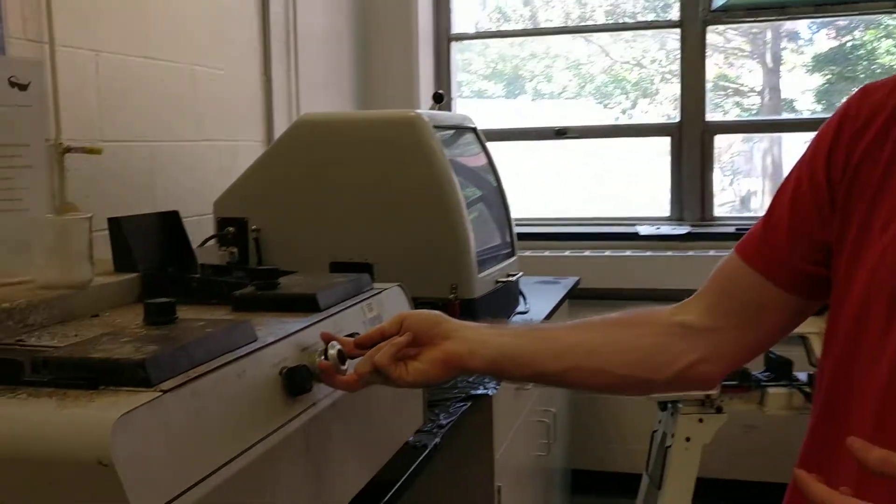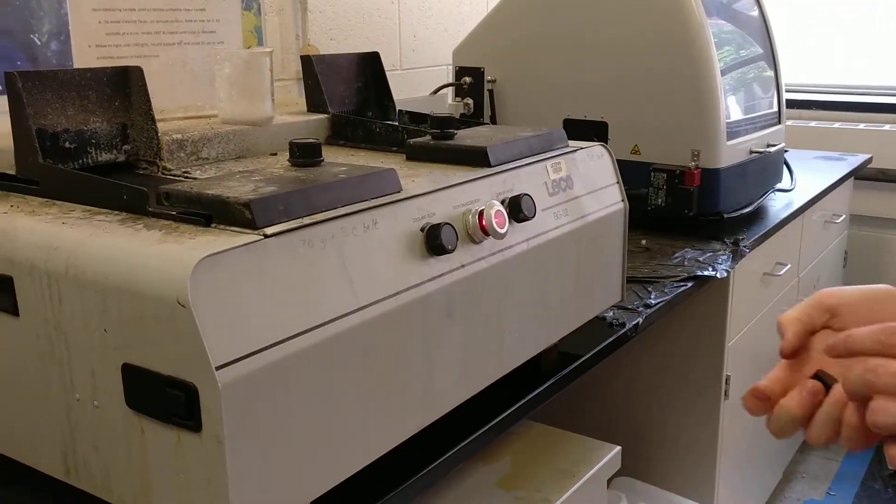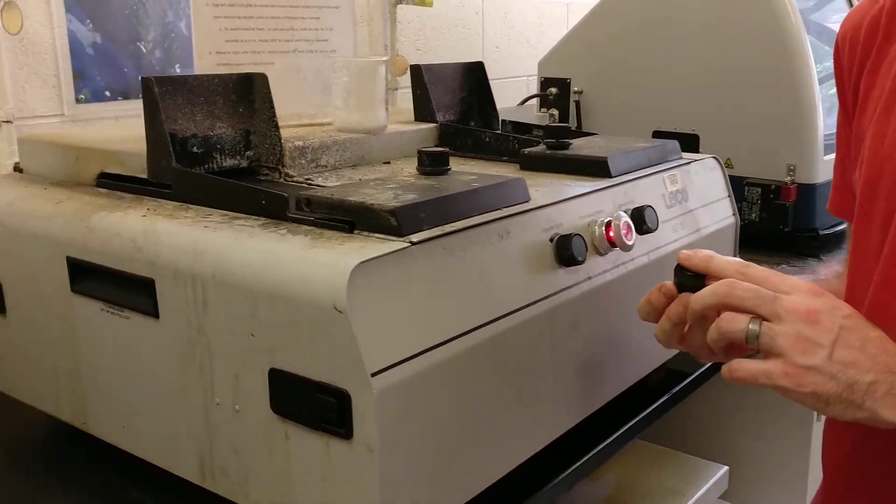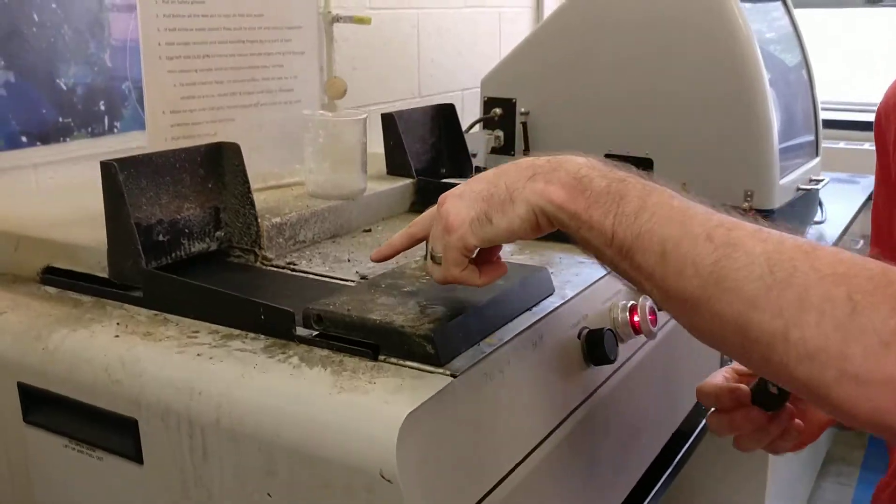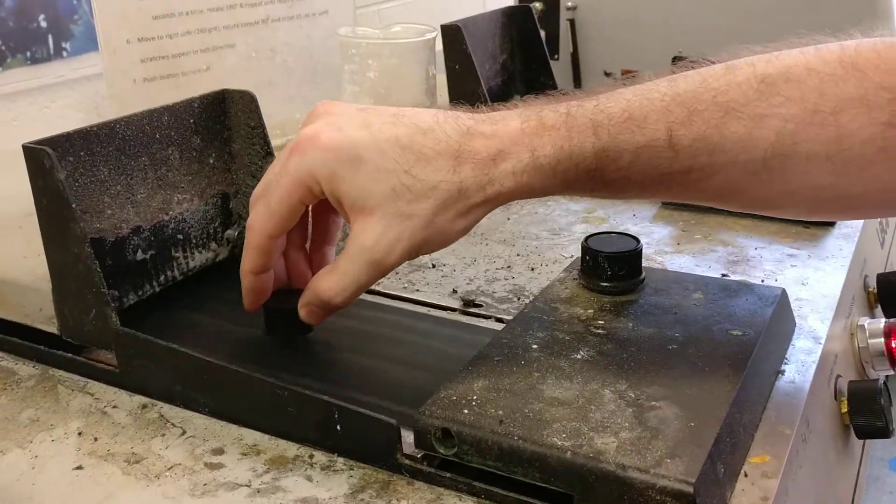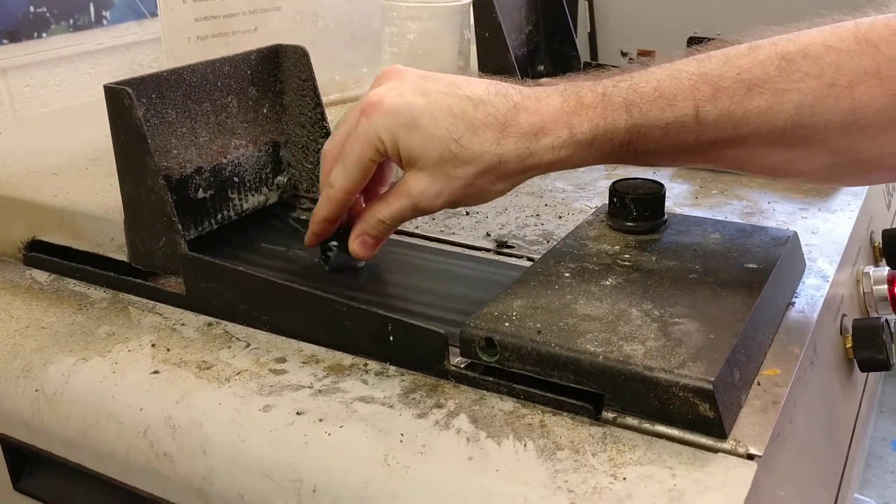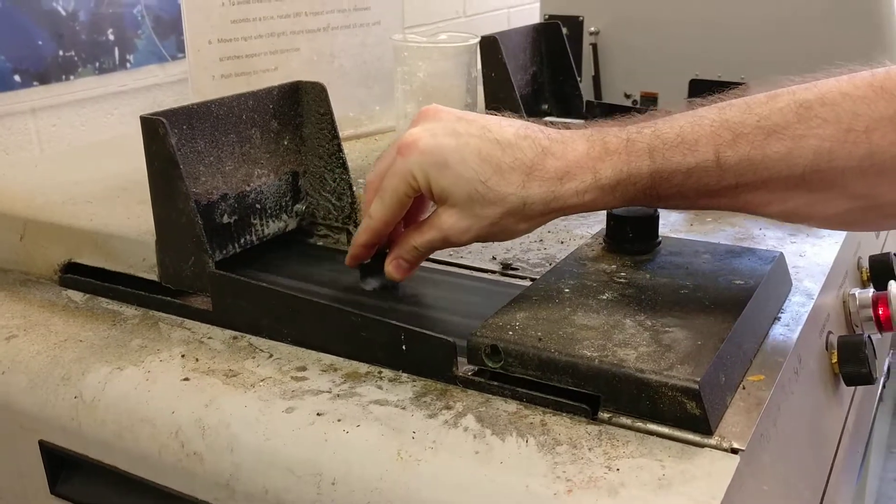All right, so we'll pull this out twice to start. Note that the water is flowing. Hold this down for only about eight to ten seconds.